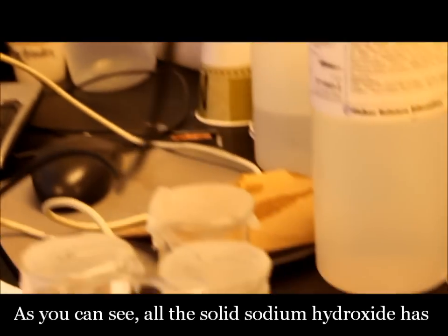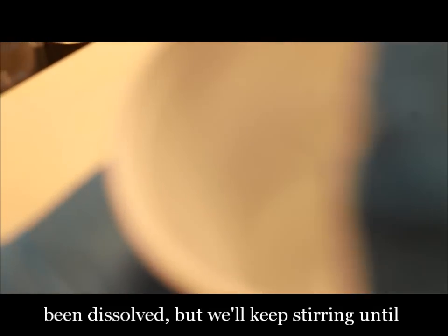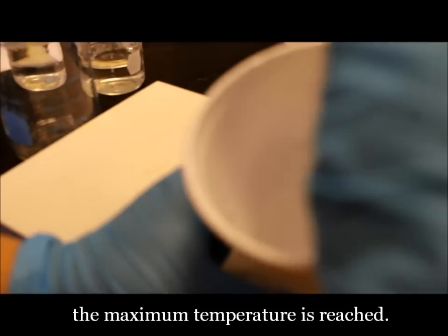As you can see, all of the solid sodium hydroxide has been dissolved, but we're going to keep stirring until the maximum temperature has been reached.